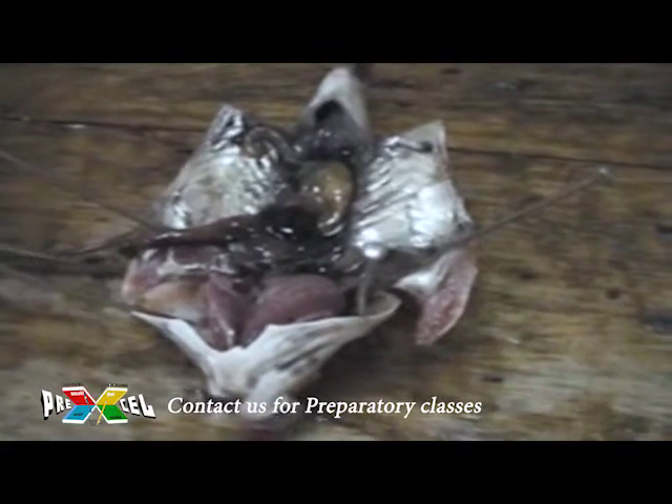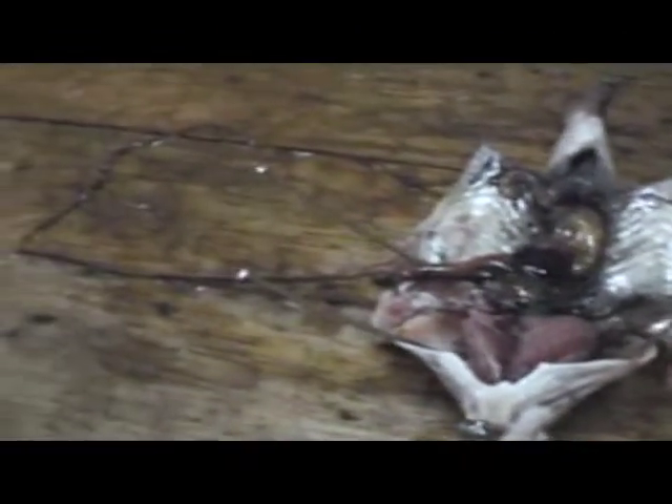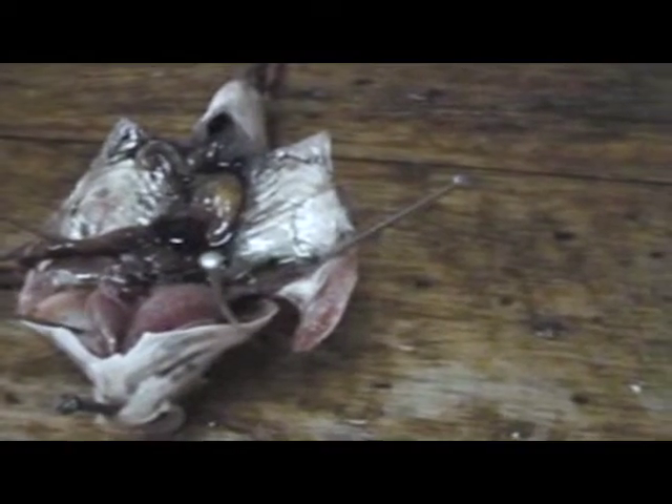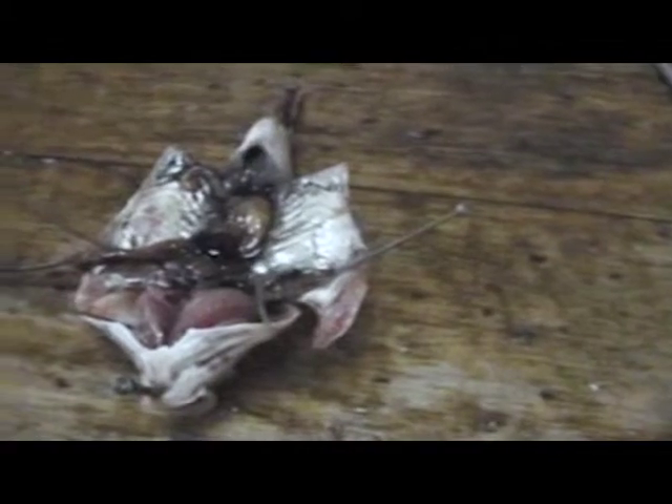These are already the intestines that come like this. The intestines are not as distinct as those of birds and mammals. If you were to display the alimentary canal of a fish, this is just all you do — you cut it, pin it like this, remove it, and you draw a diagram that looks like the one we put on the board.